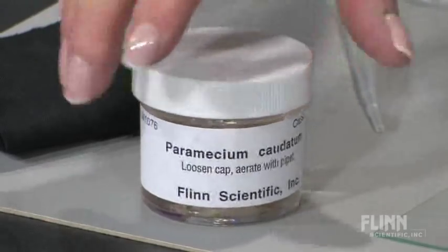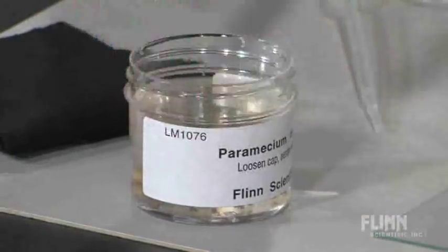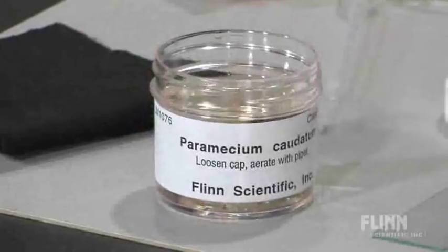A culture that has a lot of paramecium, you can simply open the jar and take a sample.